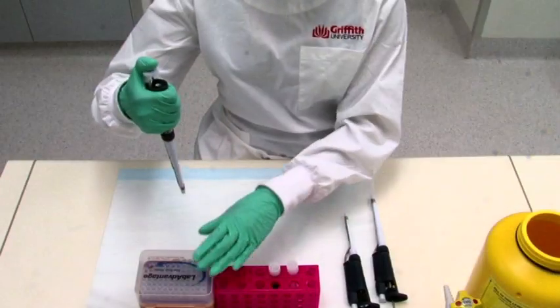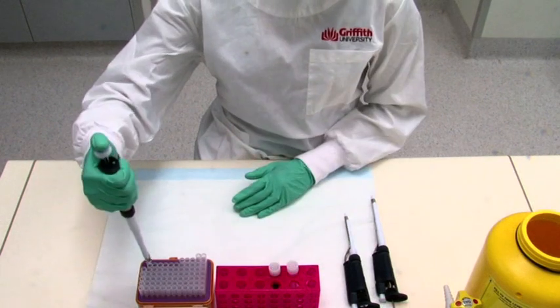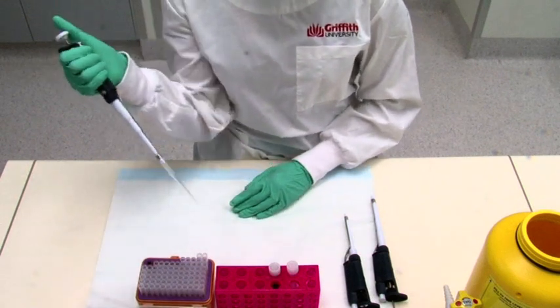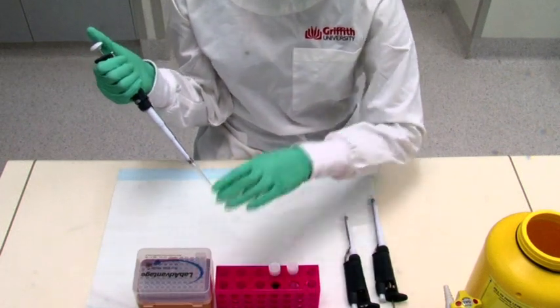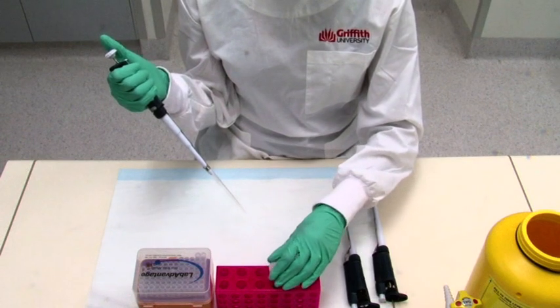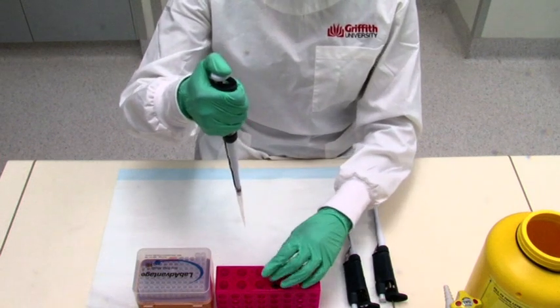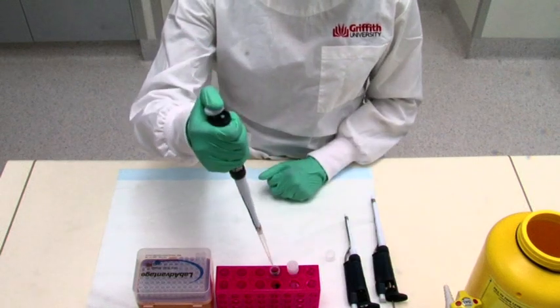Open the pipette box with your free hand. Push the pipetter firmly with a slight twisting motion into the pipette tip and remove the pipetter with the attached tip from the tip box. Close the tip box. Press the plunger down with your thumb until you feel pressure, which is what we call the first stop. Remove the lid from the tube containing the stock solution that you want to pipette.